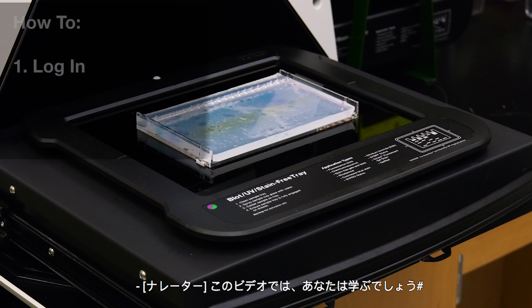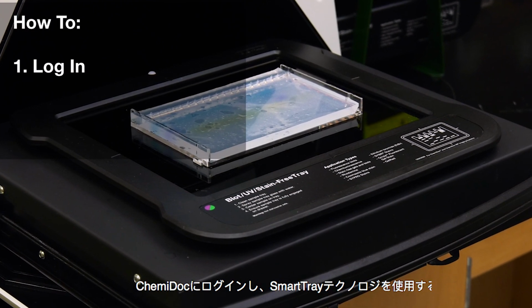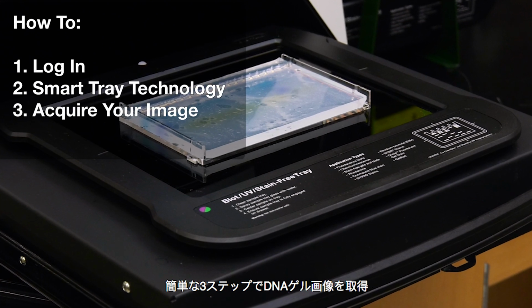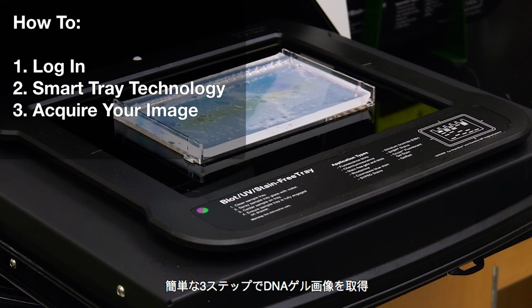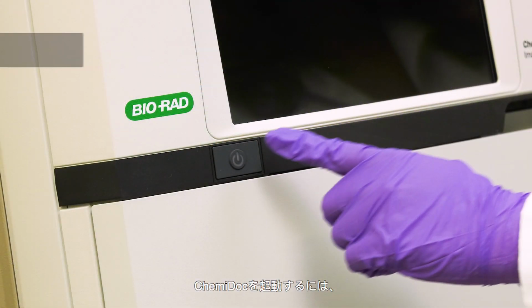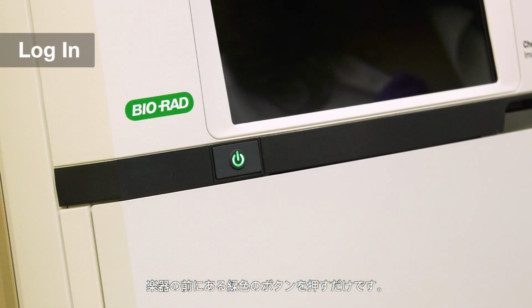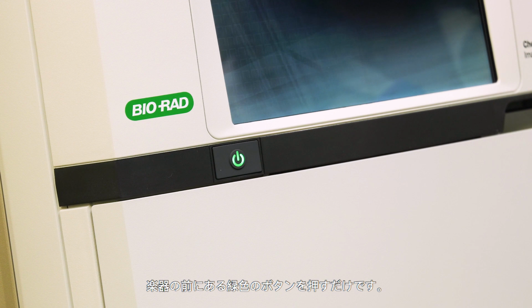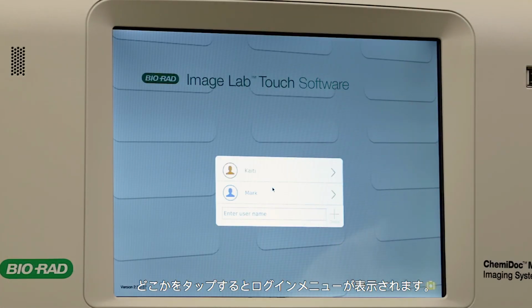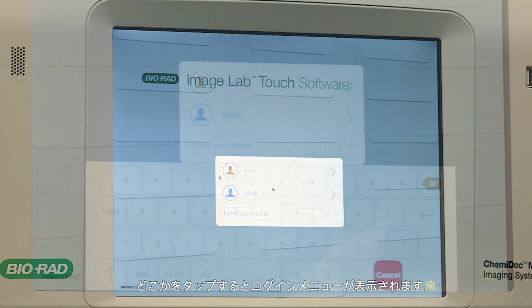In this video, you'll learn how to log in to your ChemiDoc, use Smart Tray technology, and acquire DNA gel images in 3 easy steps and export them. To turn on your ChemiDoc, simply push the green button in front of your instrument. When the customizable home screen appears, tap anywhere and your login menu will appear.